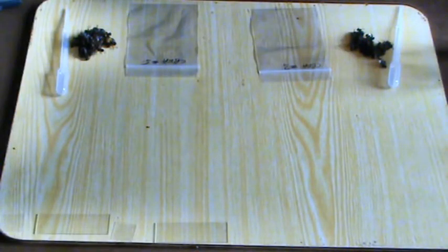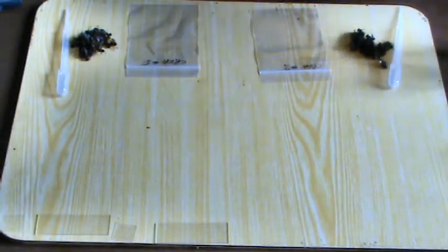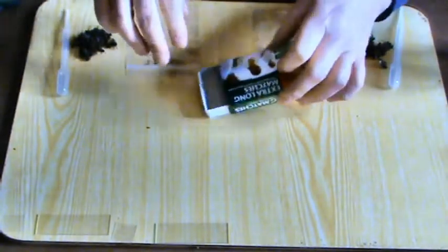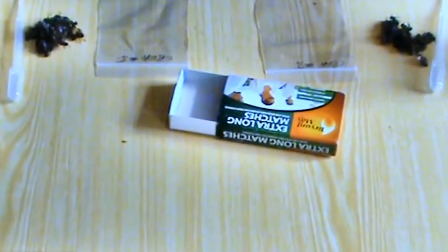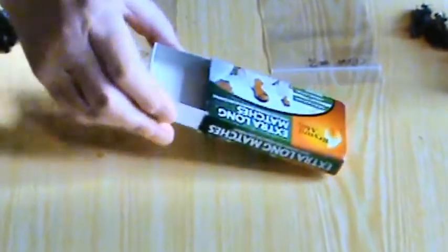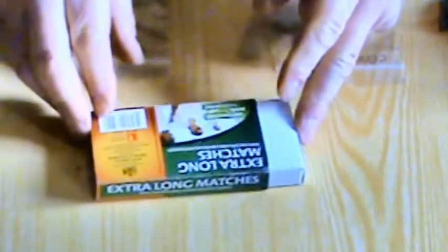You need to take a sample of 30 bees, and you can collect those from the front of the hive in a matchbox like this. Block the entrance to the hive, let the bees gather on the front, and then put that on the front of the hive over the bees and just slide it shut. So the bees are trapped in there.